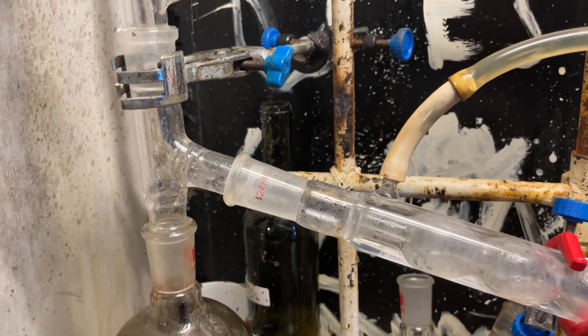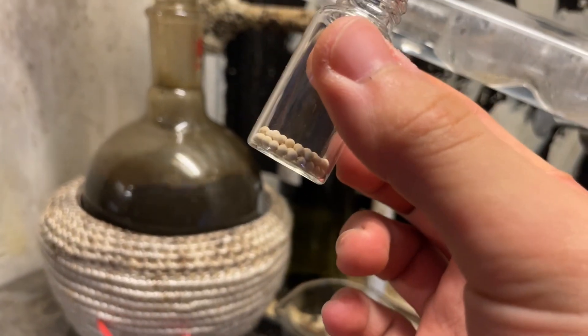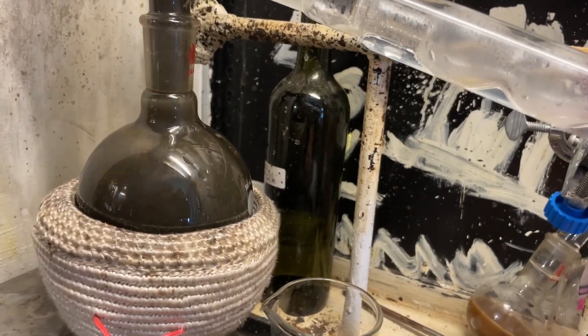I'm just lazy, and it would not fit in the fume hood. It's a bit large. It's gotten worse now, so I'm going to try adding the magic ingredient — molecular sieves. The idea is it helps nucleate the boiling.